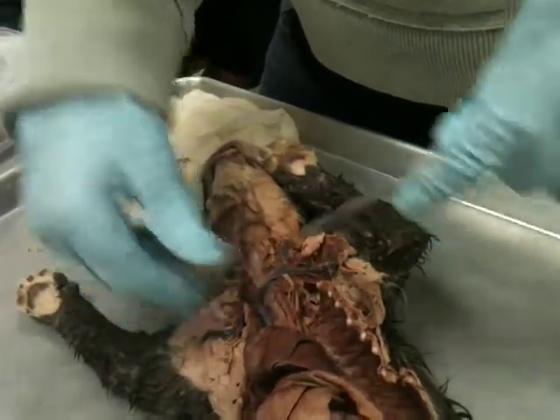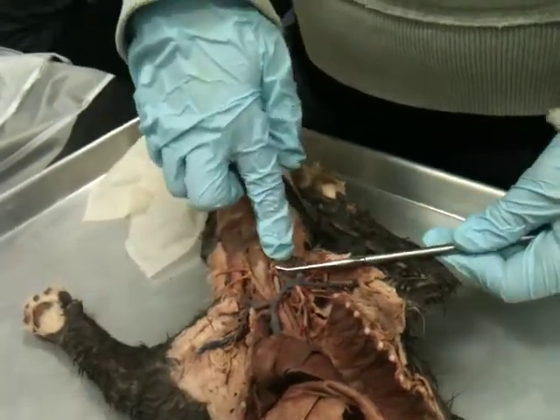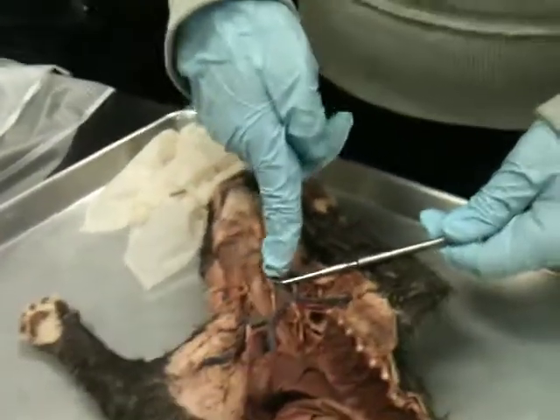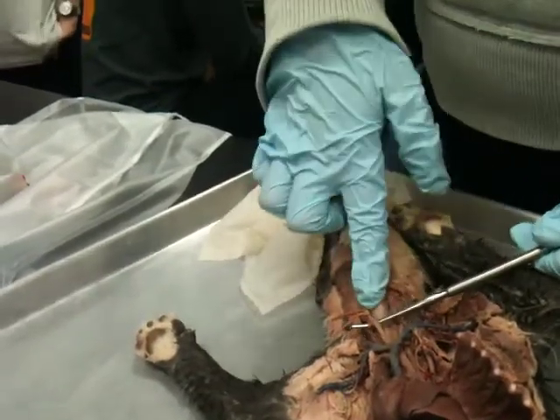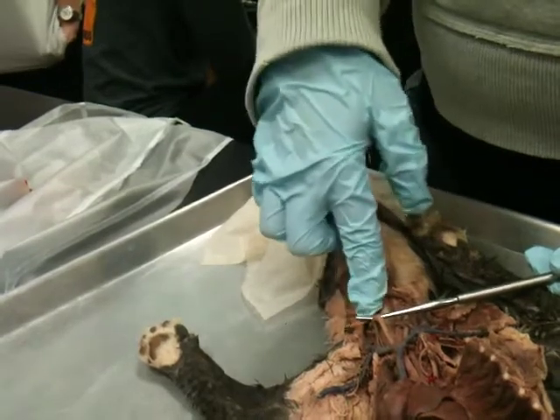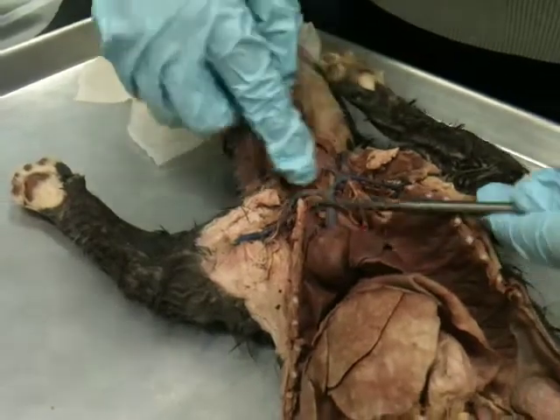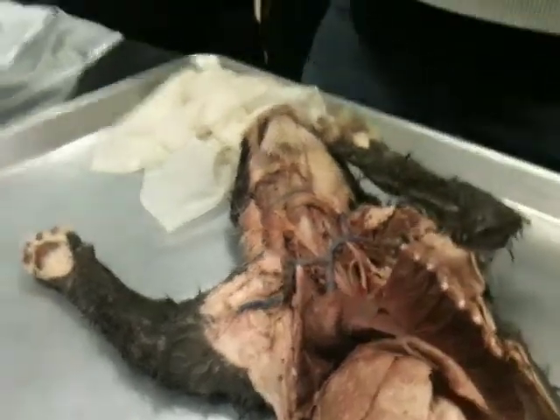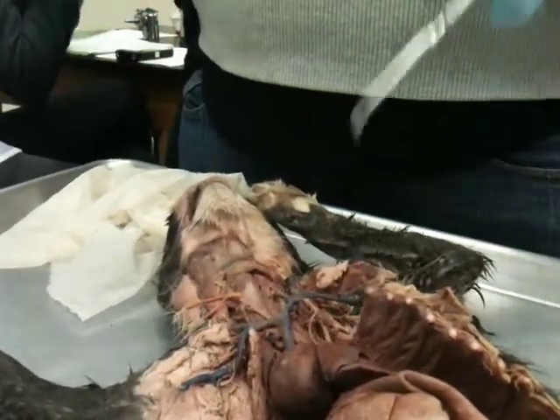So the leftmost branch we can see here, coming up into the neck, what do you think that's called? The common carotid. Yes, and this is specifically the left. Then this middle branch we can see comes up here on the right side of the neck. So that's the right common carotid. And then the rightmost branch off of the brachiocephalic artery here goes over into the arm. Left subclavian or right? Right subclavian artery. So keep that in mind. The right subclavian branches off of the brachiocephalic artery, whereas left subclavian branches directly from the aorta.